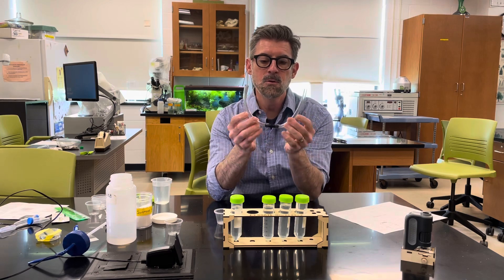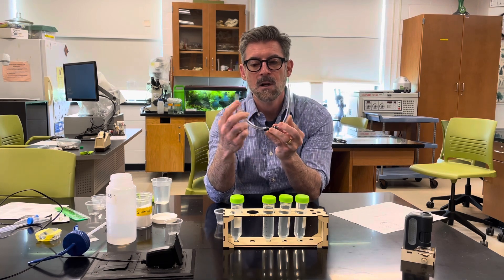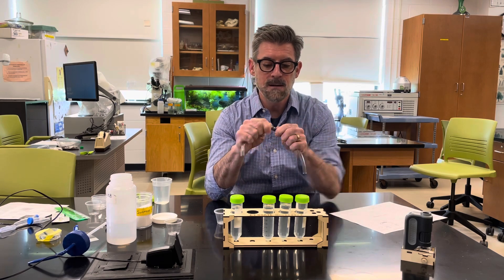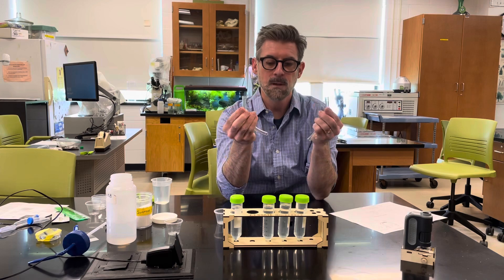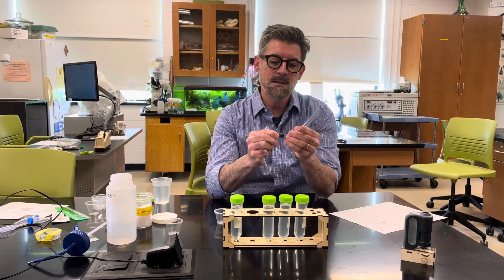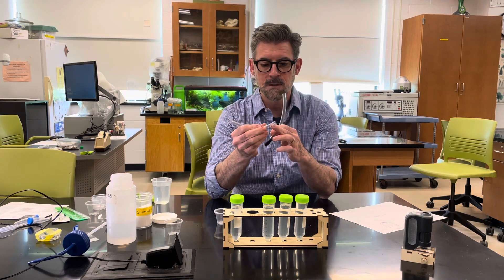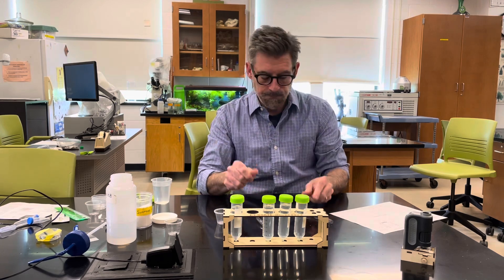We're doing something called a U-tube experiment because it's shaped like the letter U. Pure water goes on one side and one of the sugar solutions goes on the other side, with the dialysis membrane in between. In your kit you have a small hose barb and two little pieces of hose. Connect one side to the barb — if it's difficult, dip the end in warm water briefly to make the tubing very flexible. Leave the other end off for now.